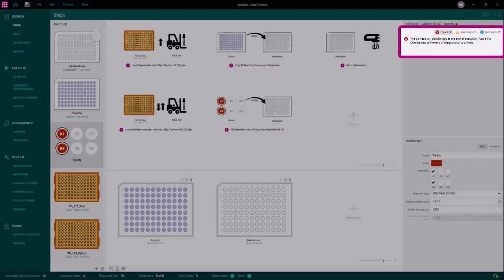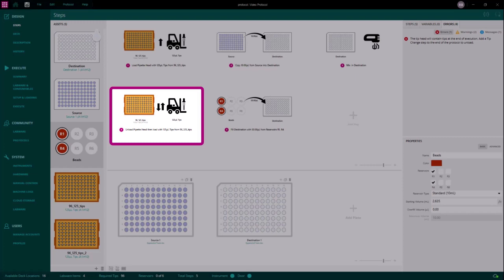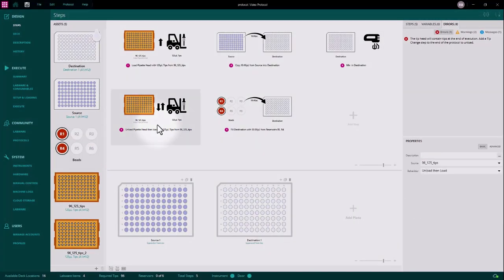There is still one error preventing us from executing this protocol. This is because we still have tips in the head at the end of the protocol. Step 4 is unloading old tips and loading new tips, but we just need it to unload tips. Let's change this in the steps property. I can do this by selecting the step and changing the behavior property to unload only. This removes all the red errors from the protocol and allows us to execute a protocol.